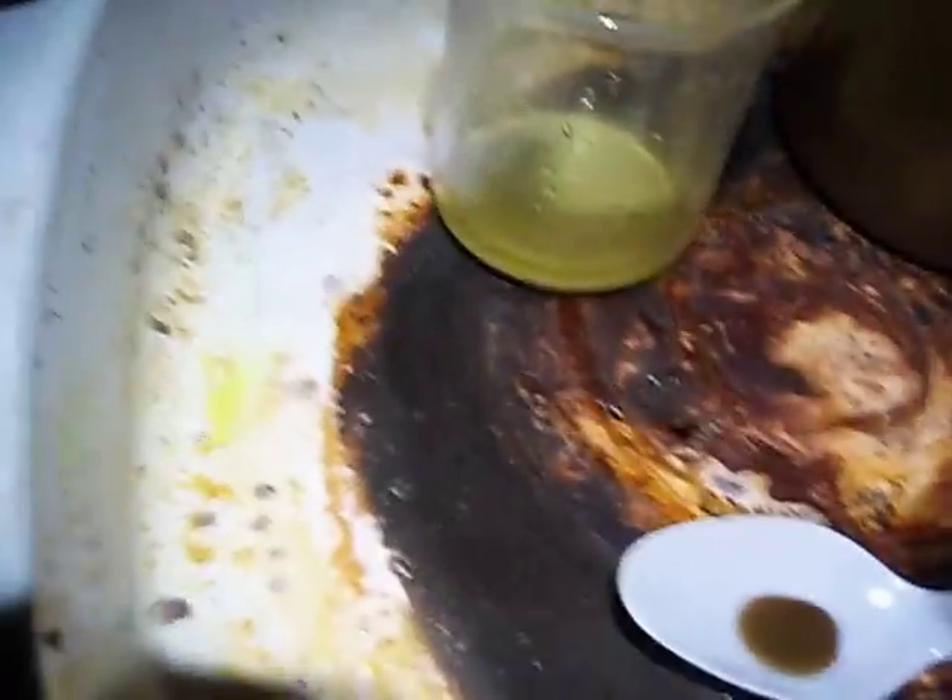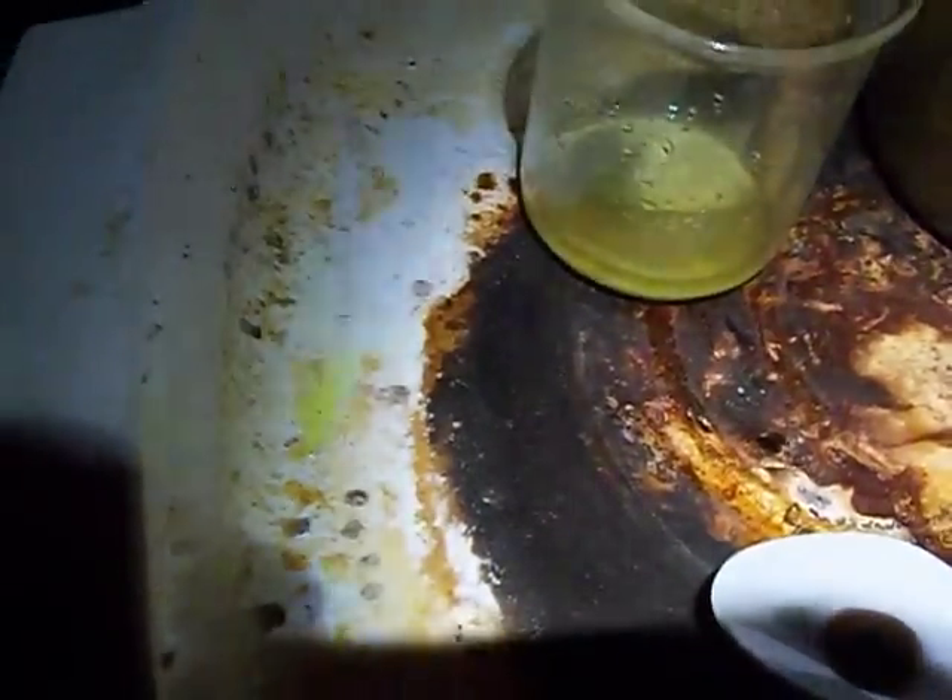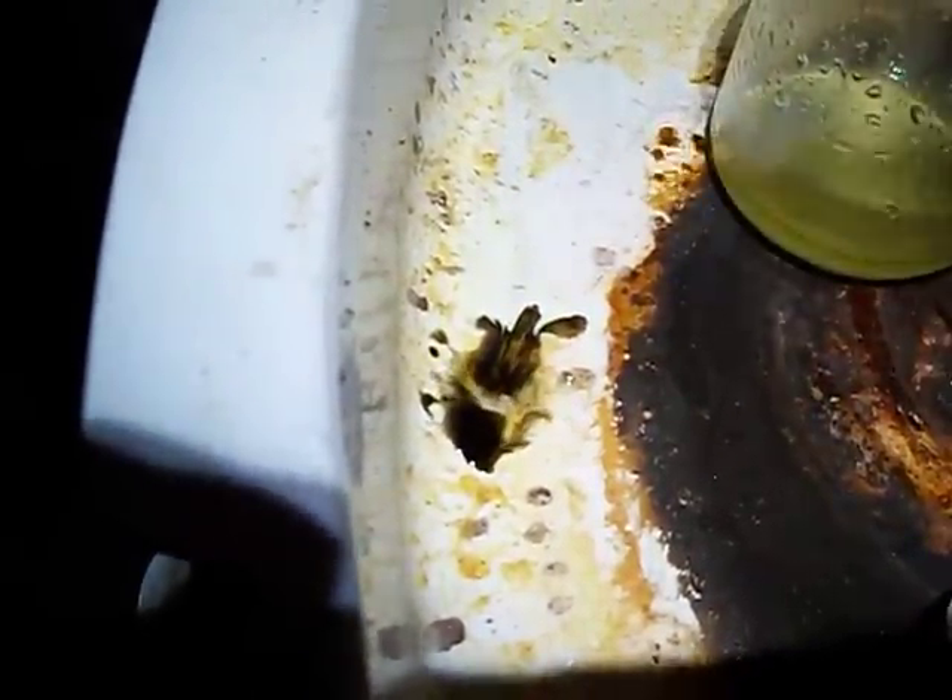This is the pan where I do all of my drops and everything, so you can see the blue and greens — that's copper in it. But if I take a drop of stannous and hit it anywhere in this pan, that's gold. There might be a pretty good bit of gold in this pan; I don't know, I may have to process what's in it tomorrow.